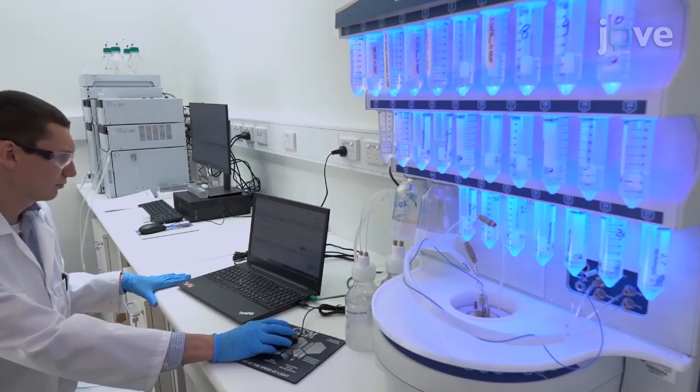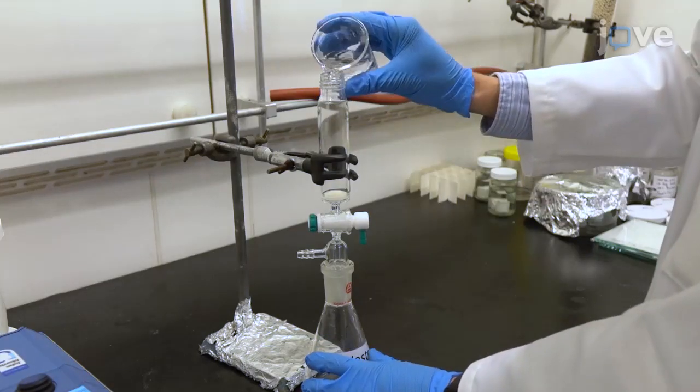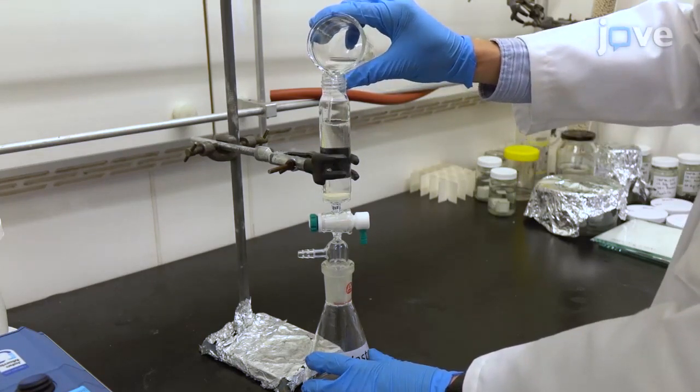When performing this technique for the first time, individuals may find kinetically trapped assemblies even after prolonged annealing times. We advise first-time users to attempt hybridizations between oligomers bearing exclusively aldehyde and exclusively amine residues, simplifying the encoded information and thus hybridization.